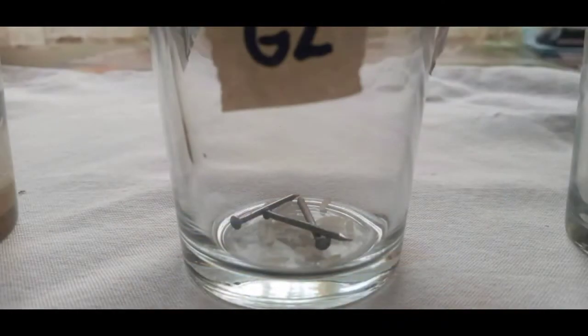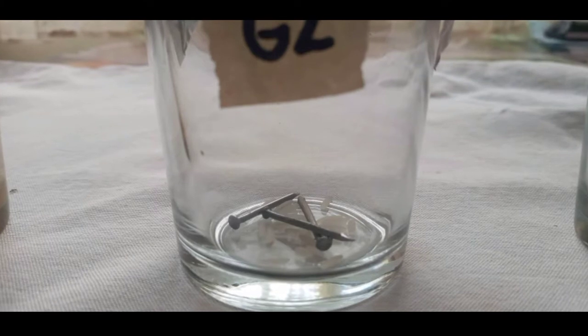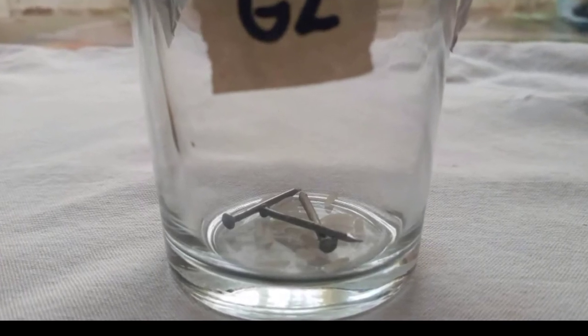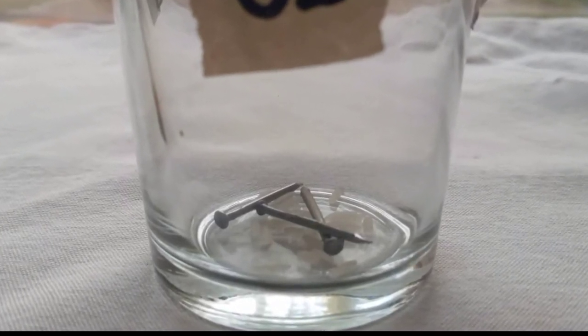Glass 2: The rusting level of the nails is low. Seems nothing changed. It has similar features. In this setup, no liquid added.